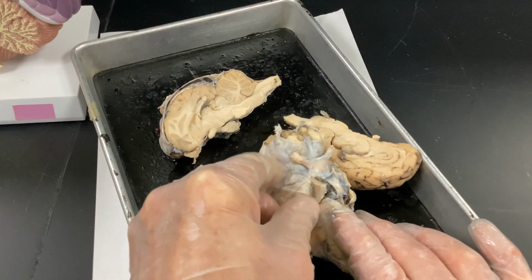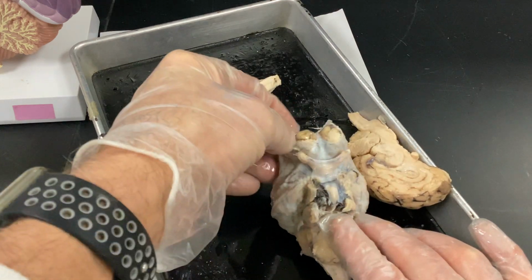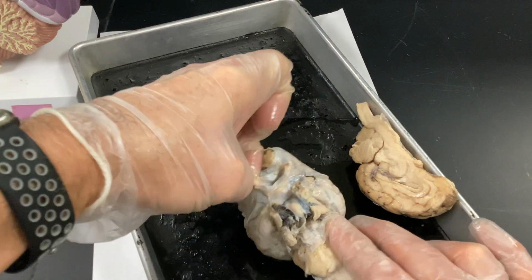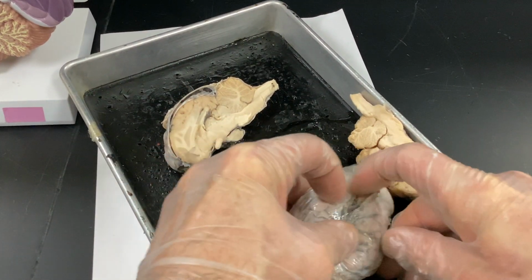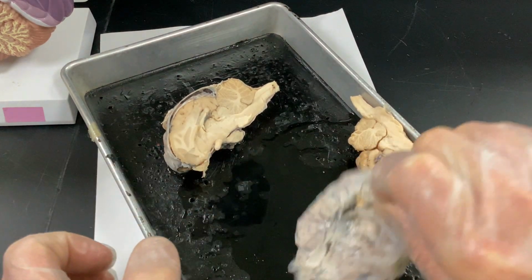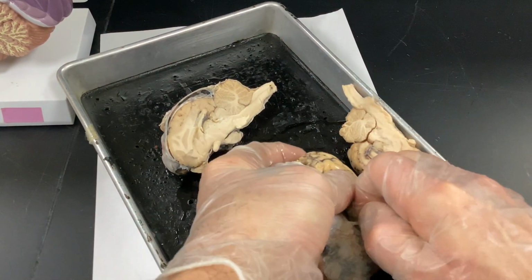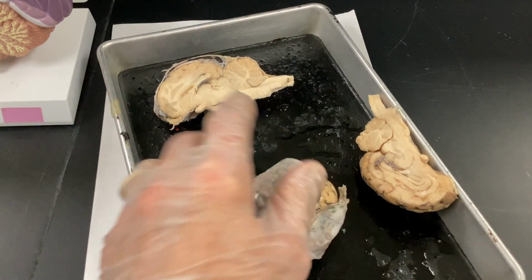But if you look, I'm literally going to see if I can stick my finger. I'm trying to look through the camera. It's not as easy. But yeah, I'm literally in here, and I can't tear this apart. It's super durable, you can probably hear that. I could probably pick this thing up. So just realize how durable it is. I'm going to actually peel it off a little bit. Probably should cut this. It's a little barbaric. Let me do that.